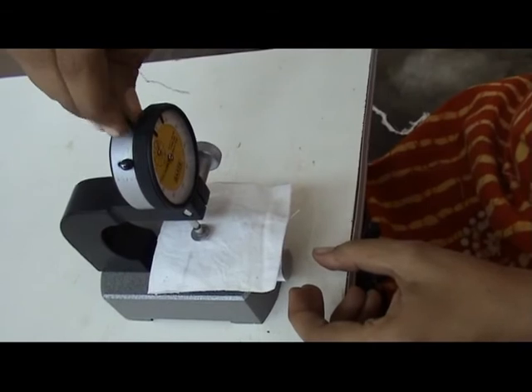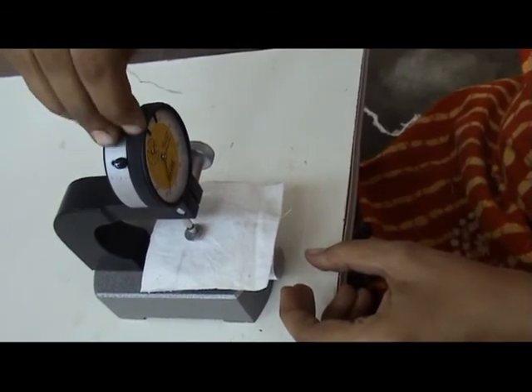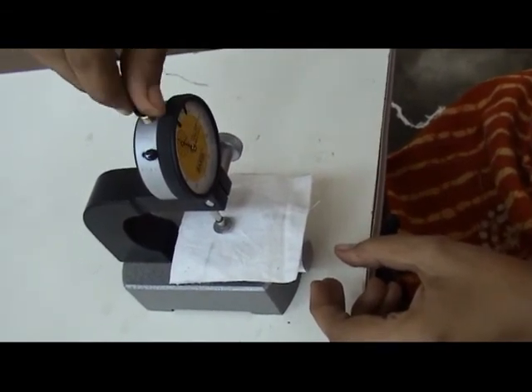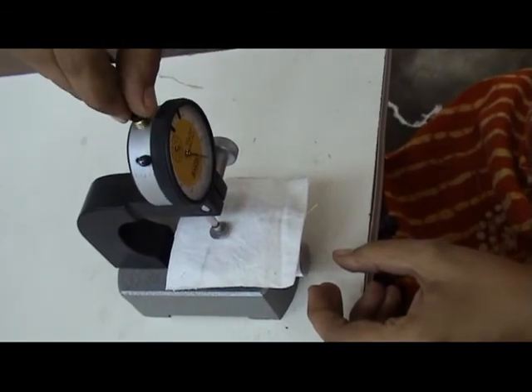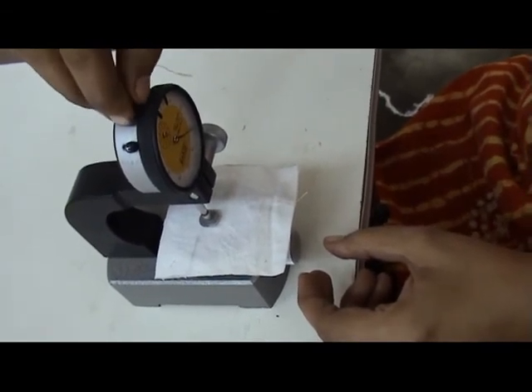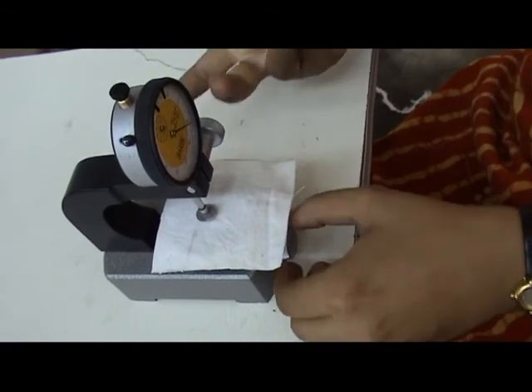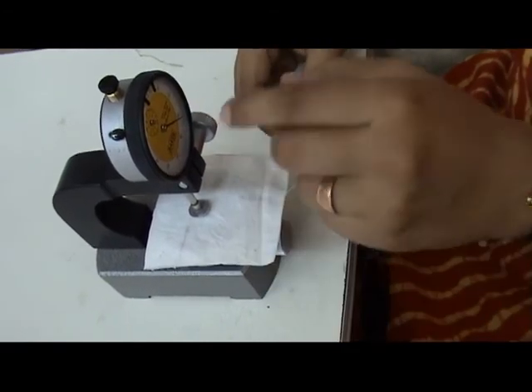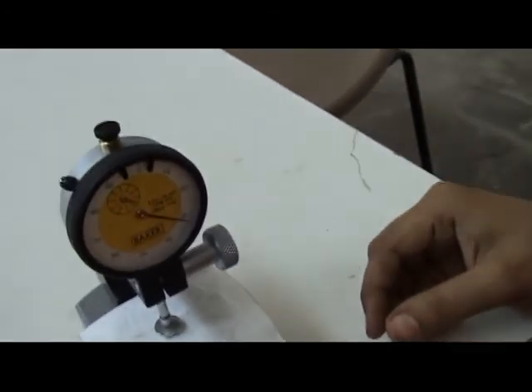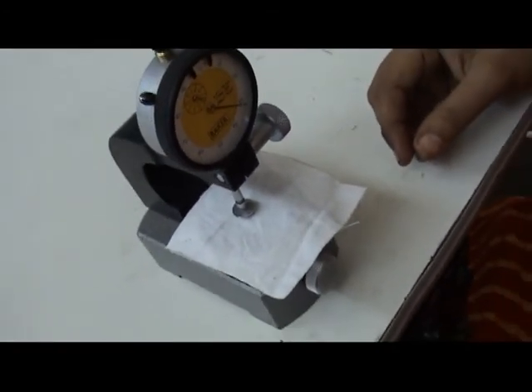The pressure foot is gradually brought down and after allowing it to rest on the fabric for 30 seconds, the gauge reading is taken. The fabric thickness is read at 10 different places on the sample and the mean of these readings is taken as the measured thickness of the sample.